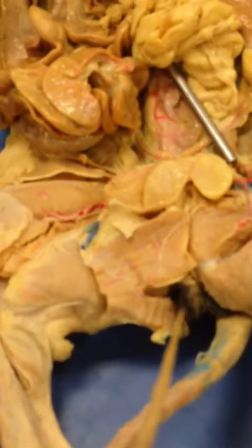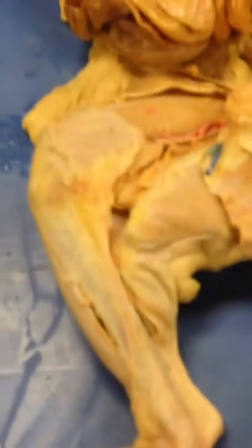And then the gallbladder. Is that going to be hard to find on that? We had the spleen.